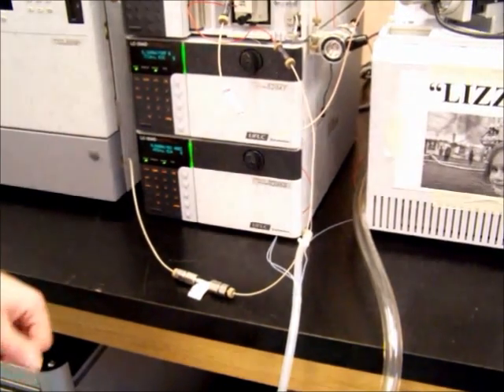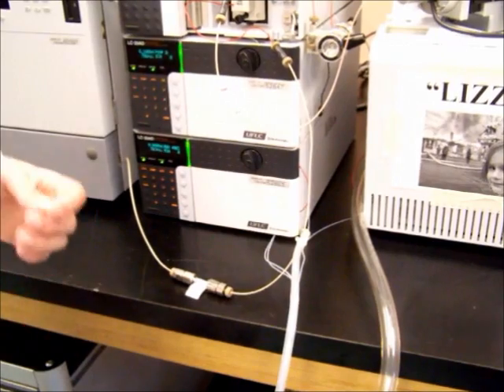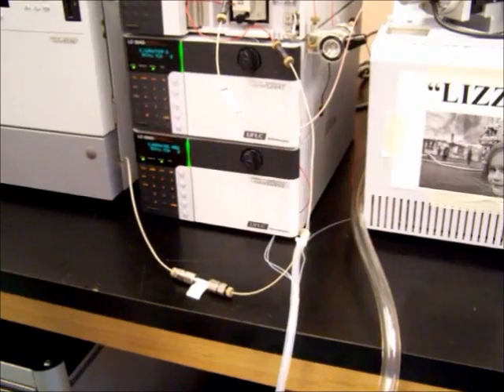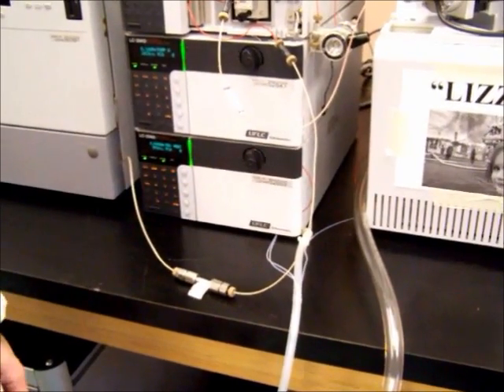As we said before, the columns are packed with special silica materials. That takes about half an hour for the column to get used to the different material traveling through it. So, we'll come back to this in about half an hour.